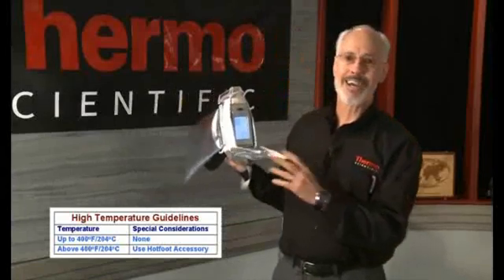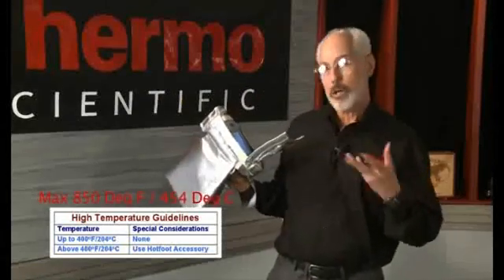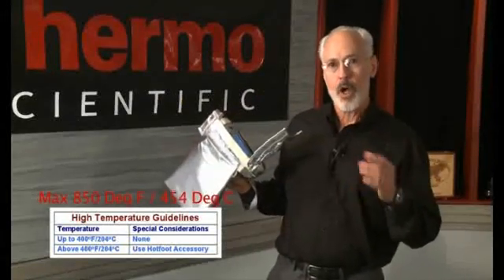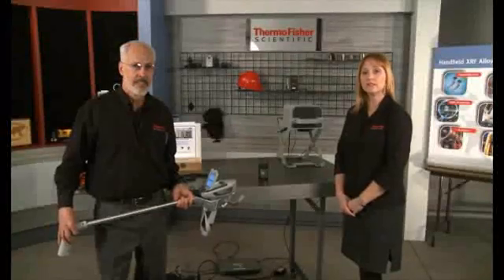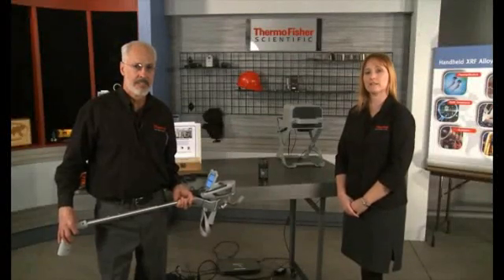If the temperature is above 400 degrees Fahrenheit or 204 degrees Celsius, place the analyzer into the hot foot jacket, which will allow operation with materials whose surface temperatures can be as high as 850 degrees Fahrenheit or 454 degrees Celsius. When measuring samples at elevated temperatures, you must wear suitable protective equipment and follow all appropriate safety practices to minimize the risk of injury. If access is difficult for the operator, the Extendipole accessory can be utilized.